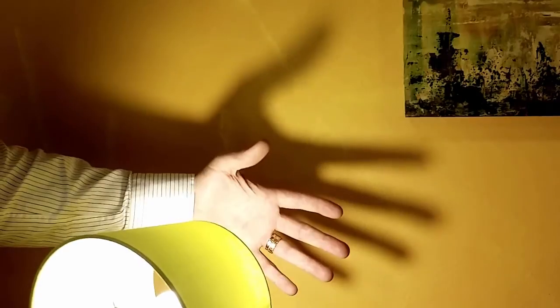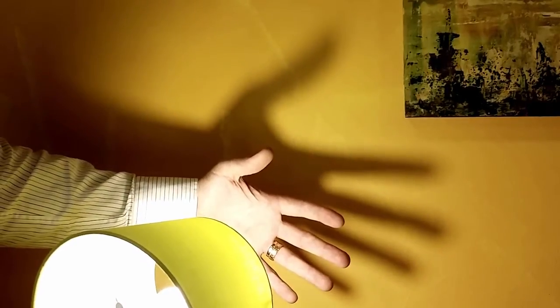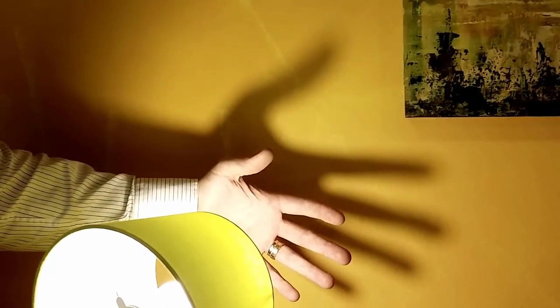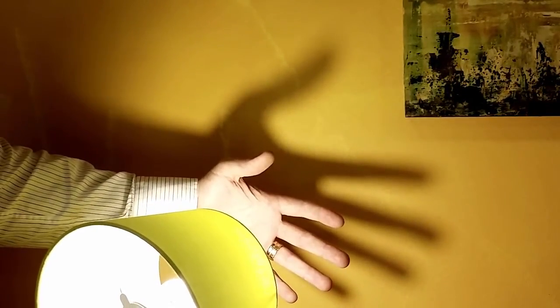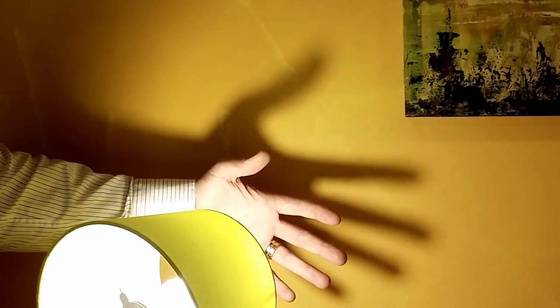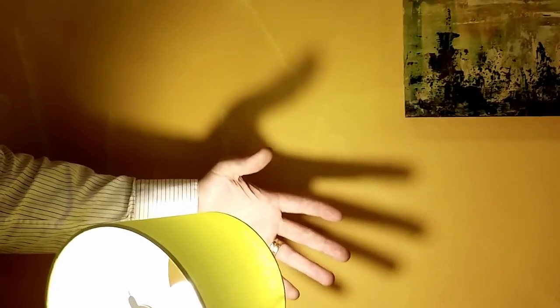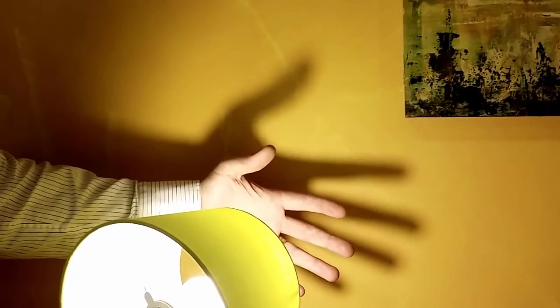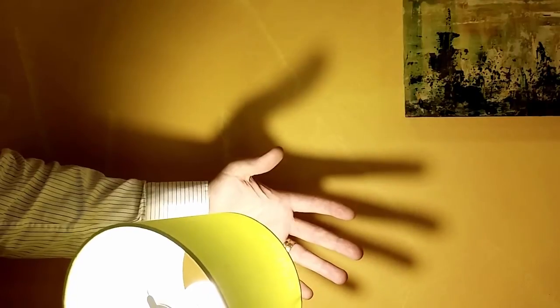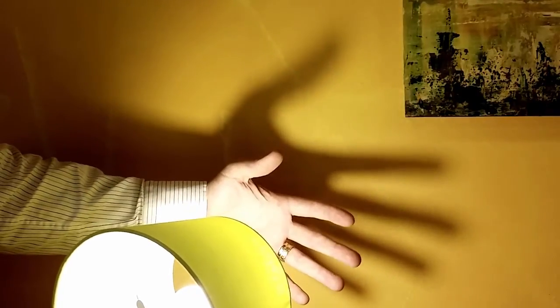One can say that my hand fully absorbs light. And in bright field microscopy, that is the feature that you are looking upon — absorption of light into the sample. The more light it absorbs, the darker spots you will get on the viewing screen.